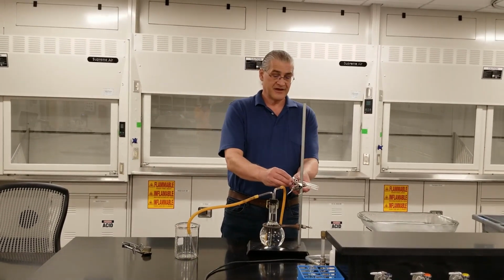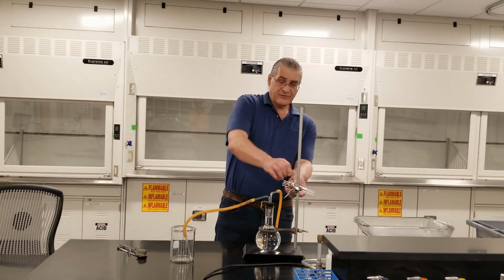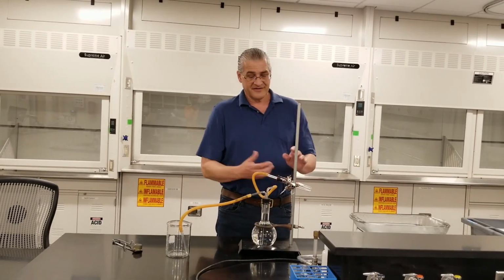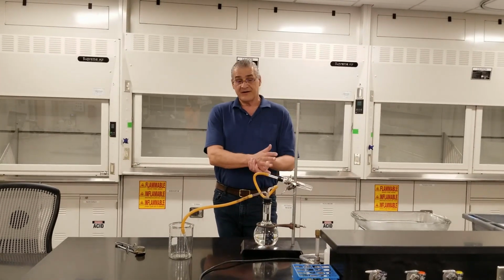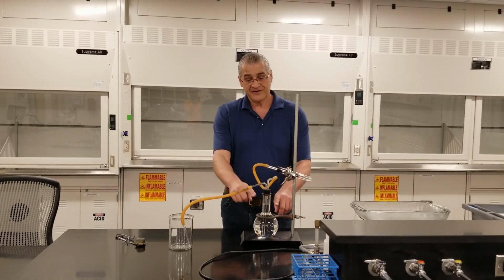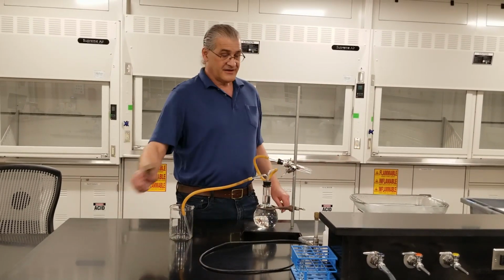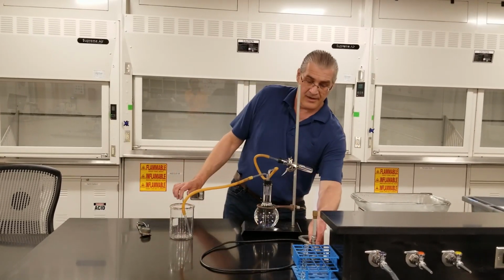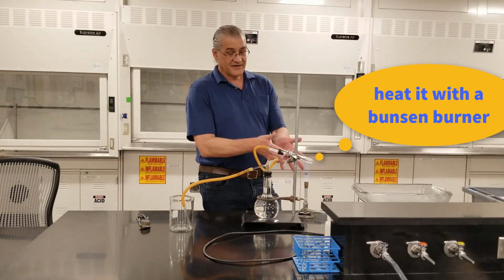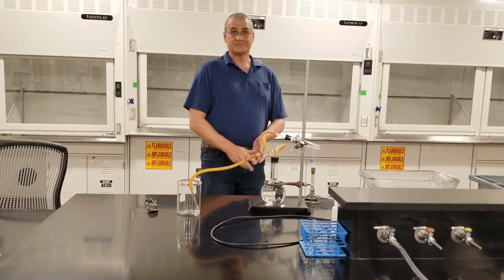It decomposes and it gives you carbon dioxide gas. And we do it in this device. You could do it without this device, but what this does is it lets you see that you are indeed carrying a reaction out. When I heat this up, it's going to make carbon dioxide gas, which is going to force this water over here into the beaker. So as I heat that stuff up, you should start to see water flow into this beaker. And that, again, is that carbon dioxide gas creating some pressure on this system.